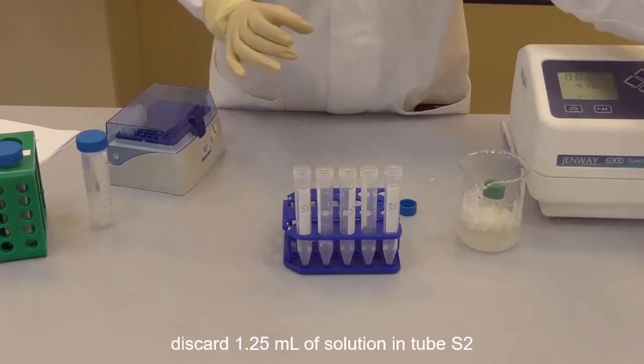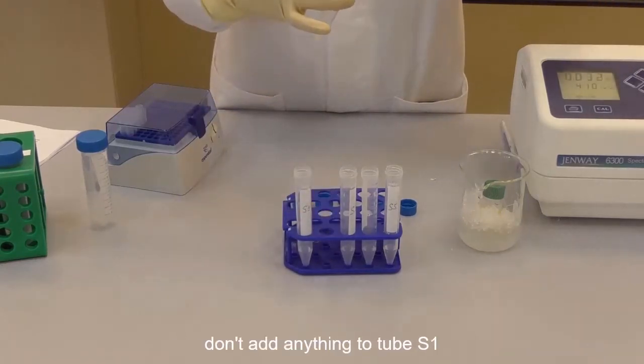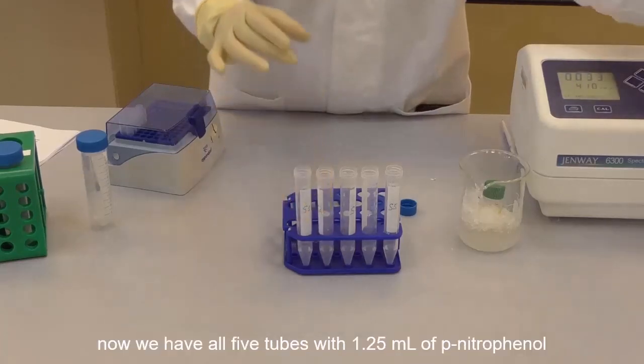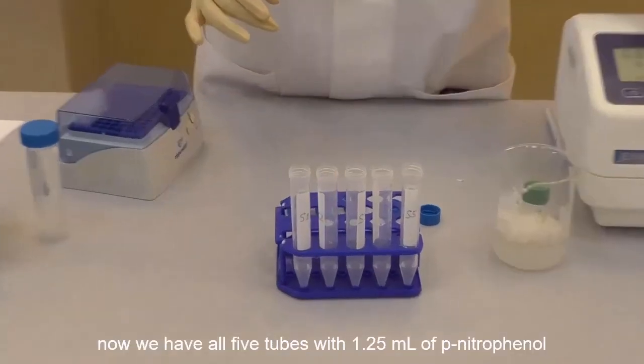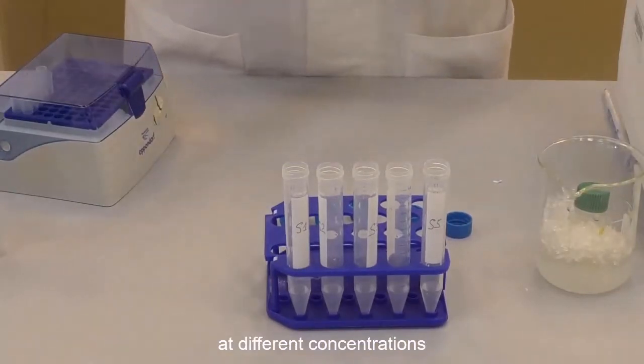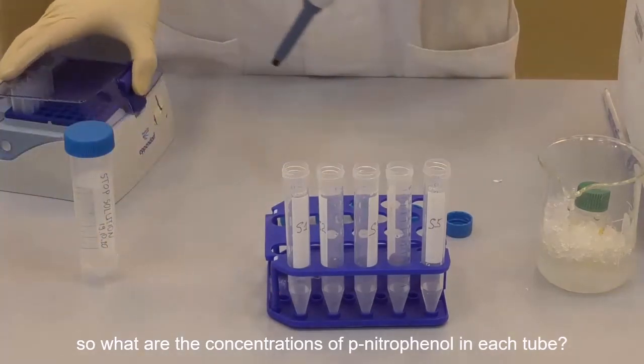Discard 1.25 ml of solution in tube S2 and do not add anything to the tube S1. Now we have all 5 tubes with 1.25 ml of p-nitrophenol. Since we have different concentrations, what are the concentrations of p-nitrophenol in each tube?